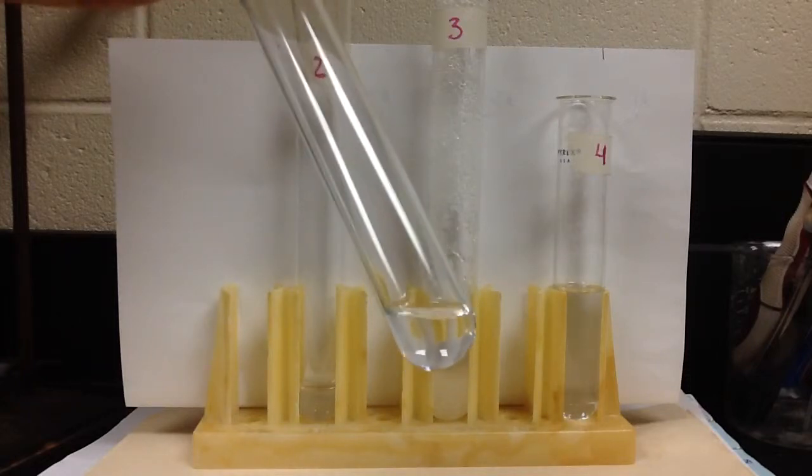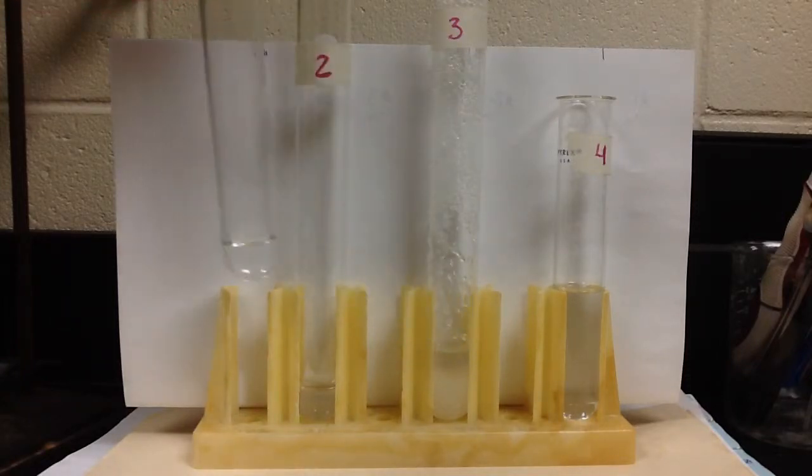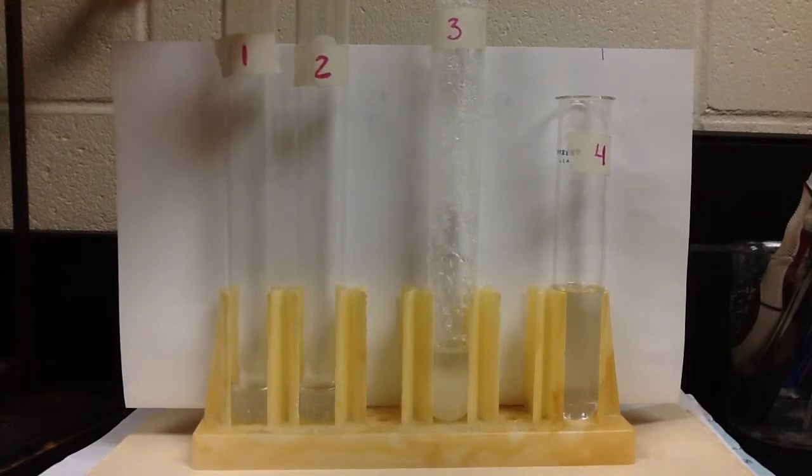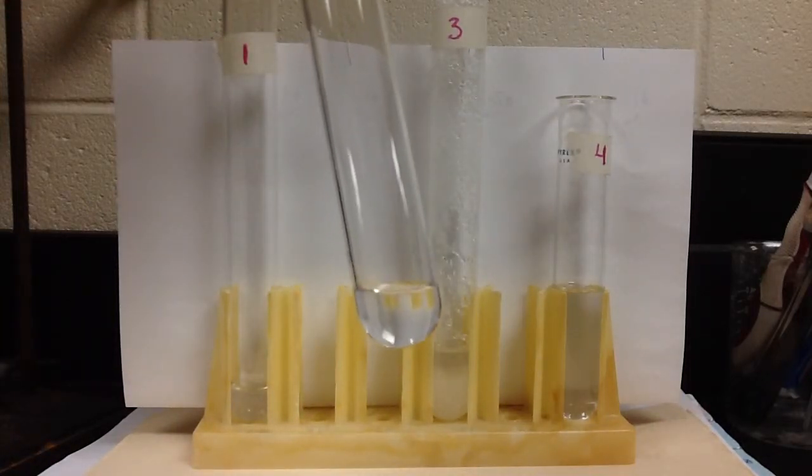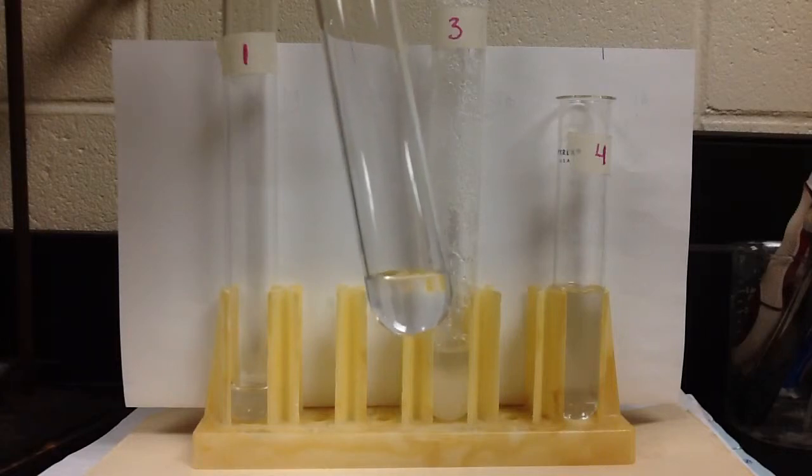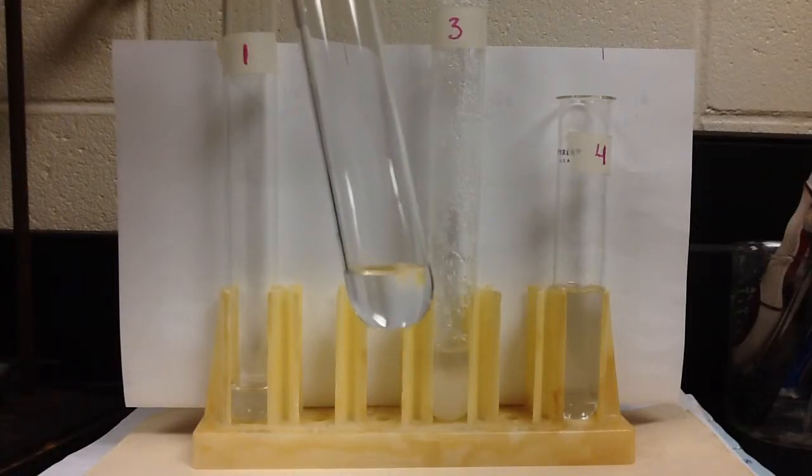So what did we do? We added another 0.5 grams to it, and the results of which we have in test tube number two. We added 0.5 grams to it, we shook it a little while, and it all dissolved. So right now, that's a total of one gram.